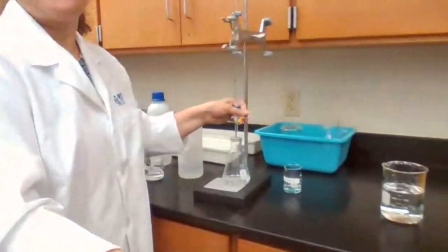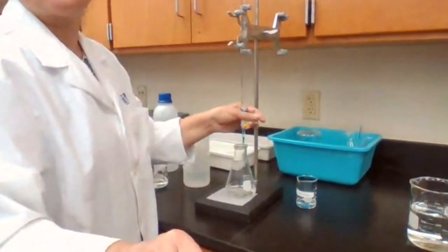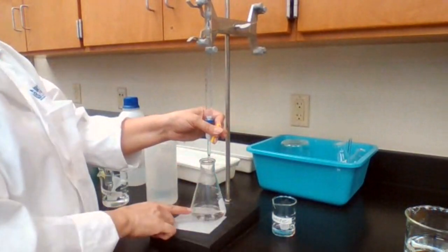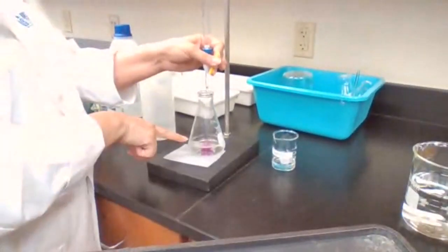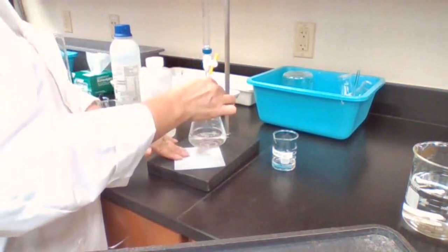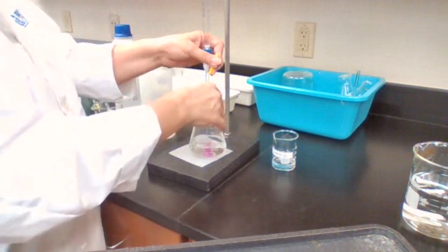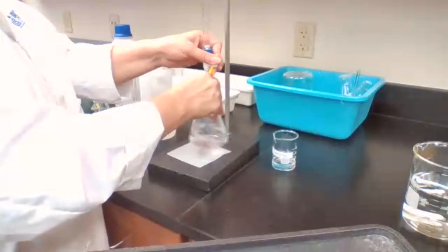At the beginning, I can add sodium hydroxide fast. I'm bringing the camera closer, so hopefully you see the color. The pink color appears in the center, and it disappears. See the pink color? It appears and then disappears when I mix it. Still not too close to the endpoint of the reaction. At one point, that pink color is going to appear and stay longer. That means we are closer to the endpoint of the reaction. At that point, I have to slow down.